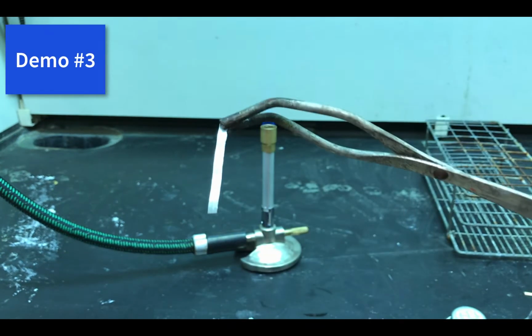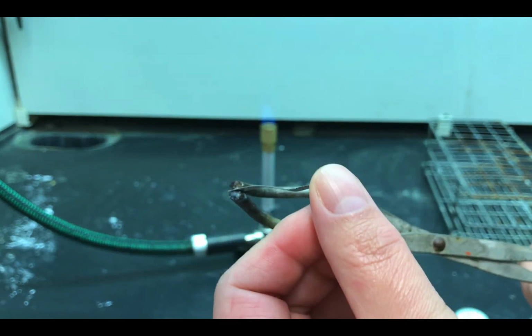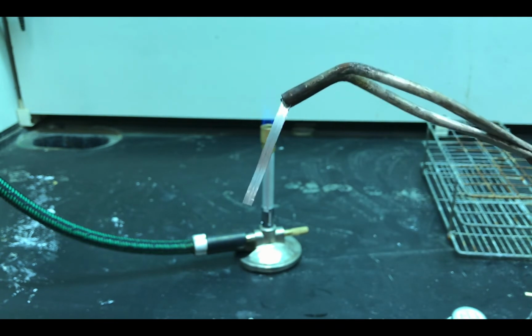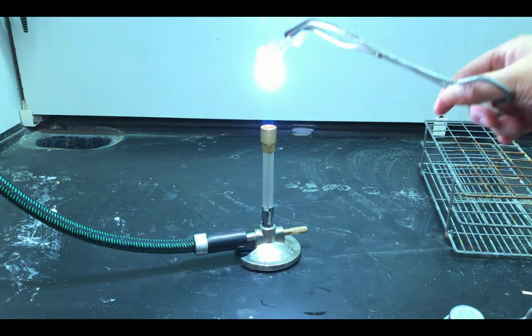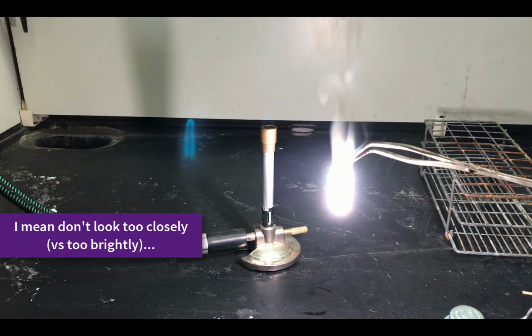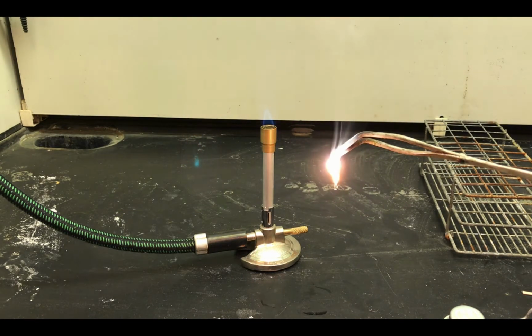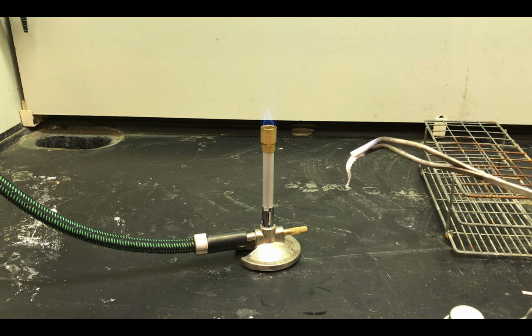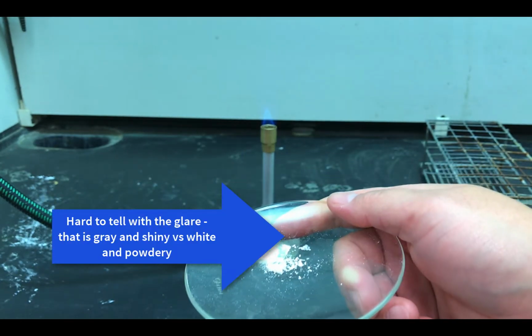Right, now to actually do the demo, here is our piece of magnesium. It is bright, it is shiny, and it is flat and flexible. And then we're going to expose it to a flame. Now take excellent observations. Look, but don't look too brightly. It's kind of like the whole sun thing, right? And then in just a moment, make sure we've got time-related observations. Get some good observations here. Now we're going to put it in a little watch glass so you can see, and it is clearly different.